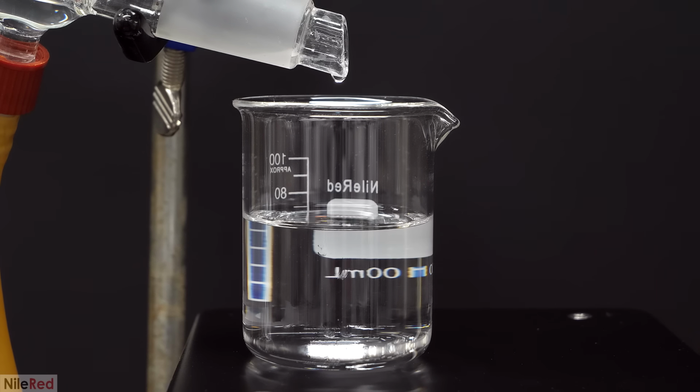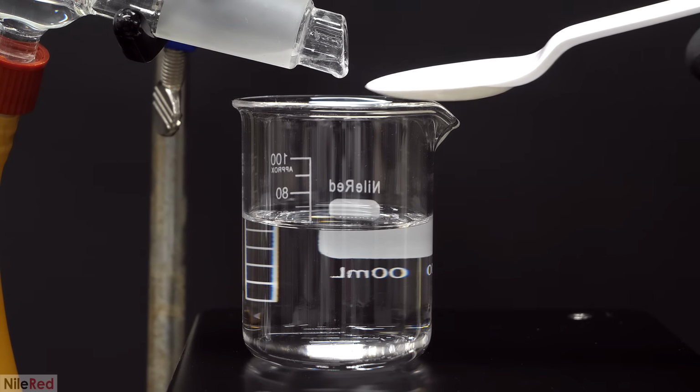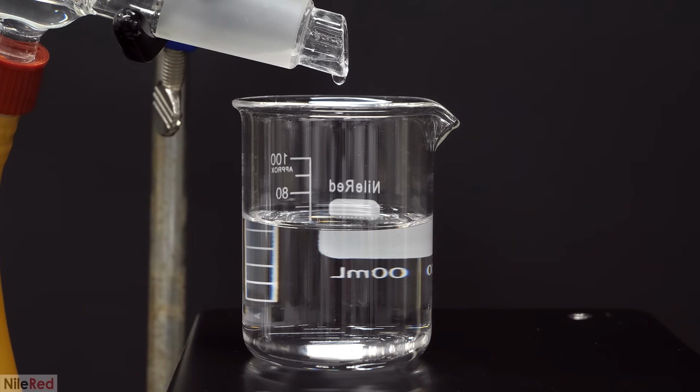The hearts, like I said before, are the most valuable, and they contain the best tasting portion. Knowing exactly when to start collecting the hearts and when to stop is one of the most important things when it comes to making a good quality product. I, of course, wasn't making a typical moonshine though, and I felt that my ethanol was a bit too precious to discard any of it. This was why I just chose to collect everything in one beaker.